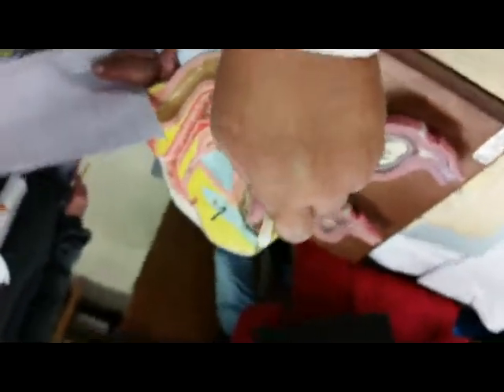So now you have a handout. I'm going to tell you, now you have to tell me what it is. What is this? Ovary. What is this? Fallopian tube. What is this? There you go, hanging over the ovary. Fimbriae. And what is this? Uterus. And cervix. And what is this? Vagina. And now the two lips have the labia minora and the labia majora, and right out there would be the clitoris. Position is important.